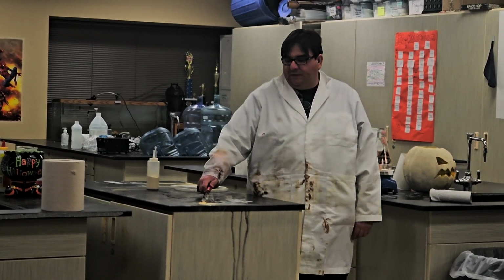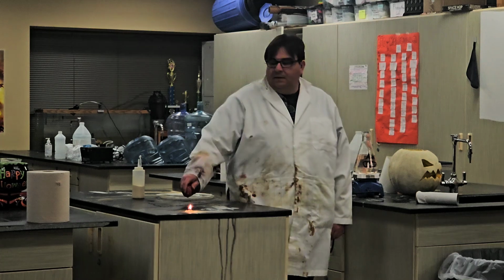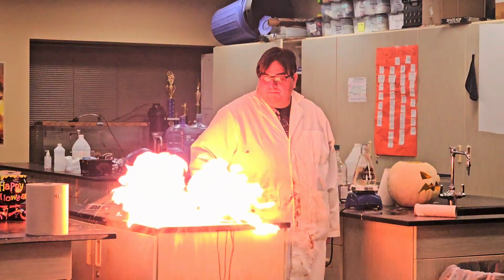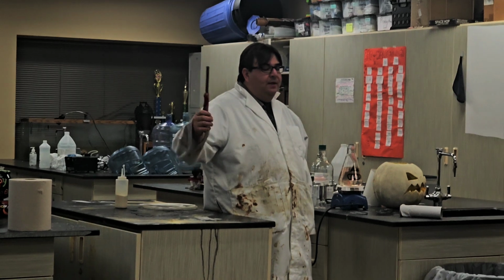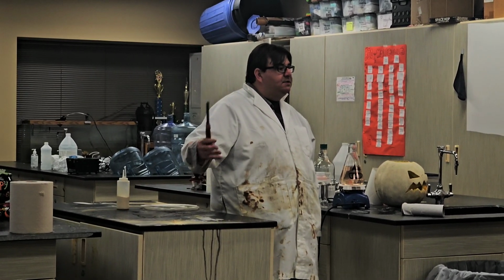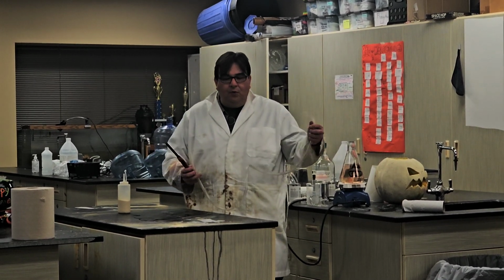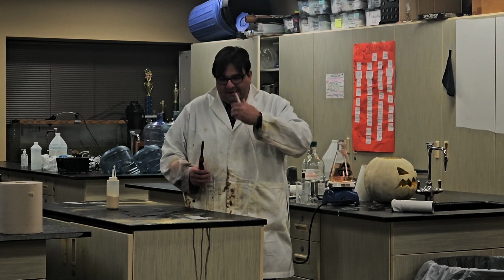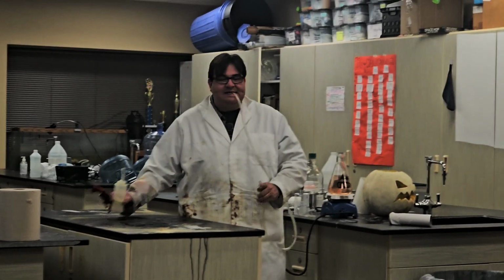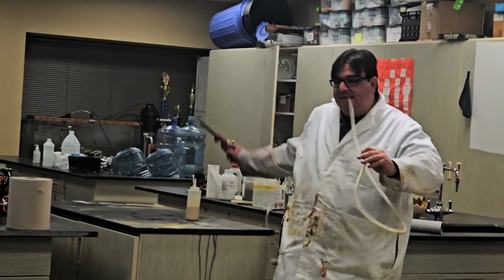Hold on, let me relight. So, by changing the air-fuel ratio, you can get much cooler things to happen. So it's not just about more of stuff to get a really cool reaction or something on fire. It's all about your ratios. All right.